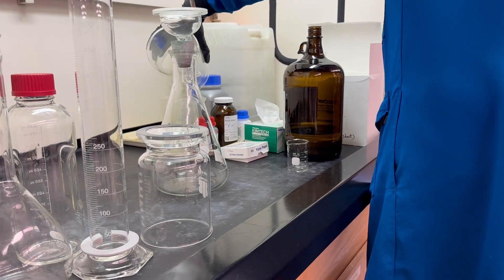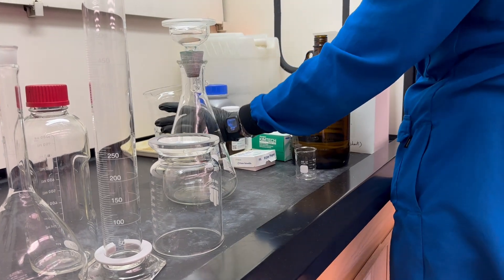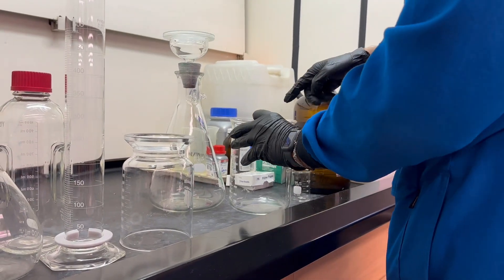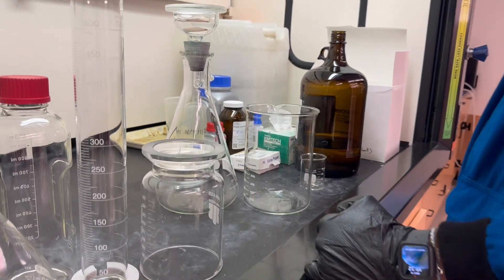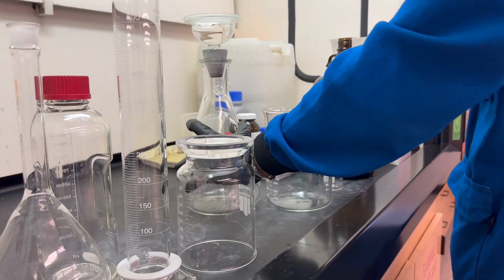Certainly, this is where our mobile phase will be transferred through. This is where we're going to be filtering. We'll make it into here, and then from here this will be poured through our filter, and then we'll vacuum filter. From here we have a vacuum filter solution.